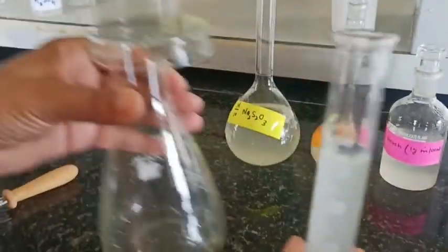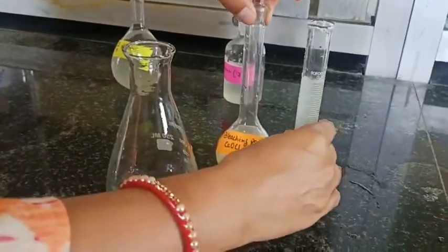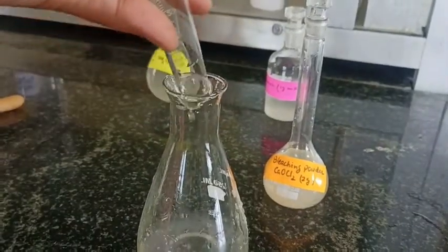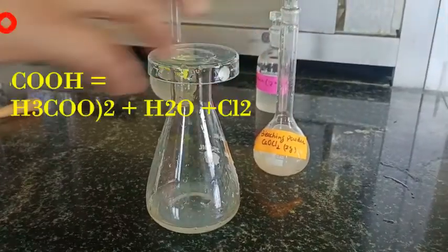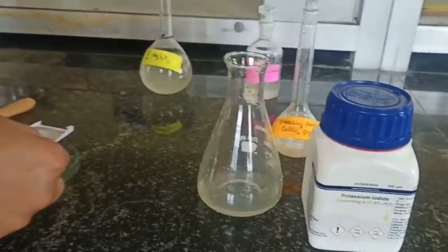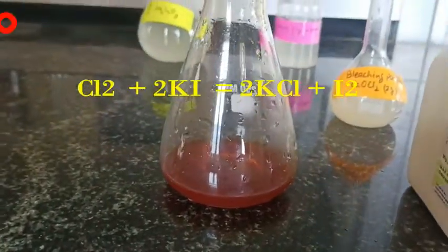Now let's see the lab activity. We require three solutions: sodium thiosulphate, bleaching powder, and starch. I have taken 25 ml of bleaching powder solution — prepared from 2 grams dissolved in 100 ml — and transferred it into the conical flask. To this I am going to add glacial acetic acid, and then add potassium iodide in solid form. As soon as the potassium iodide is added, you can see the brown color of liberated iodine.